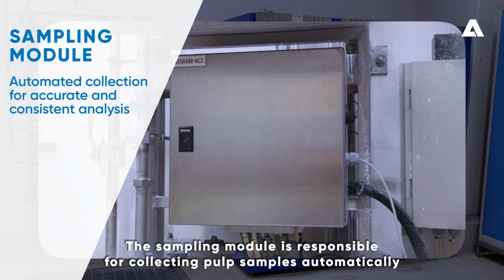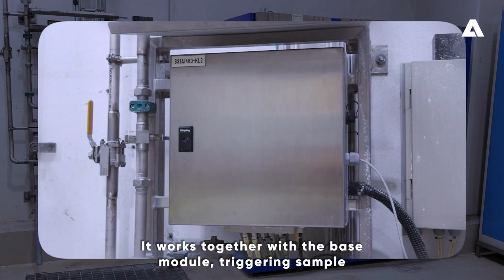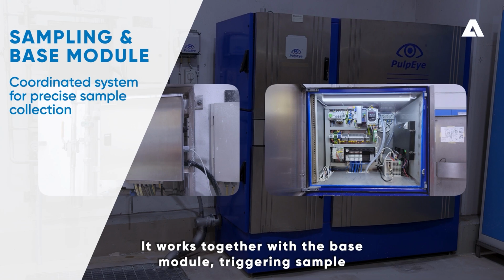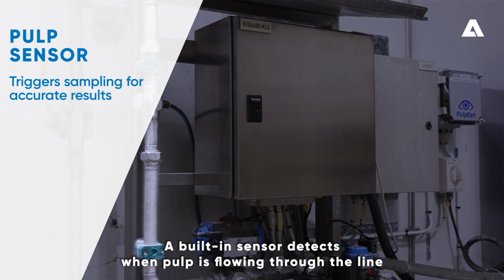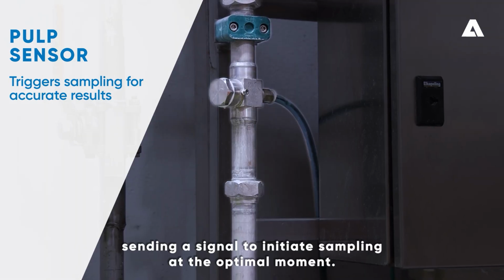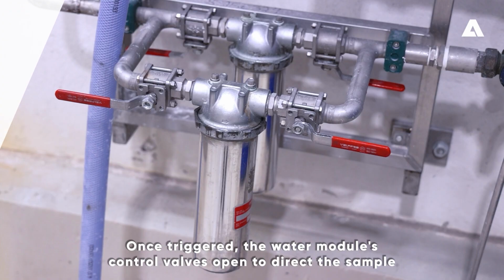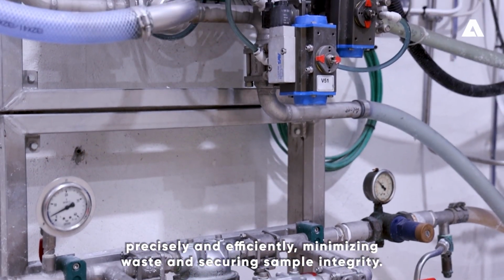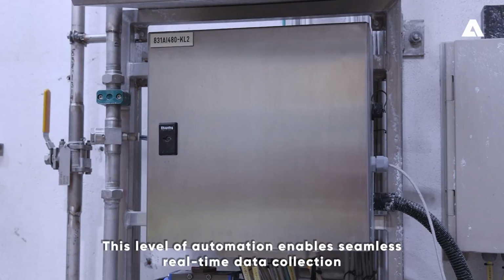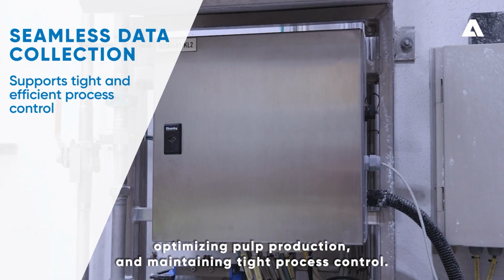The sampling module is responsible for collecting pulp samples automatically, ensuring accurate and consistent analysis. It works together with the base module, triggering sample collection at the right intervals for reliable process monitoring. A built-in sensor detects when pulp is flowing through the line, sending a signal to initiate sampling at the optimal moment. Once triggered, the water module's control valves open to direct the sample precisely and efficiently, minimizing waste and securing sample integrity. This level of automation enables seamless, real-time data collection, optimizing pulp production, and maintaining tight process control.